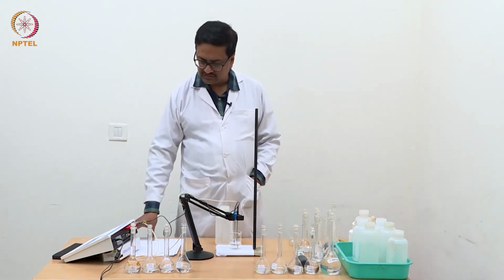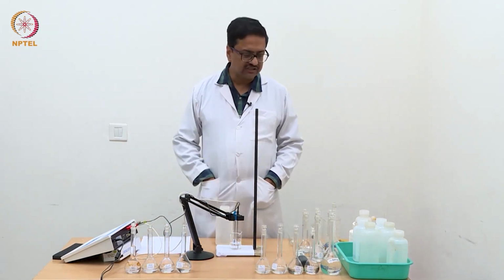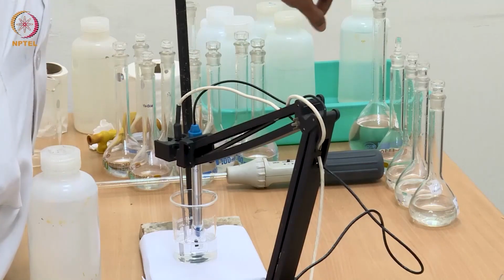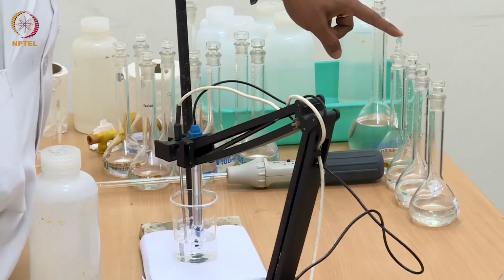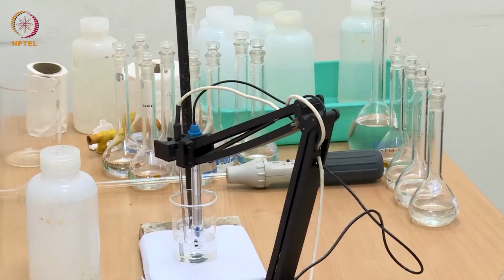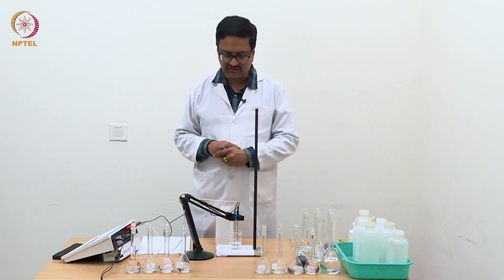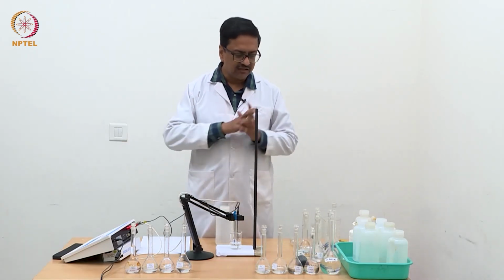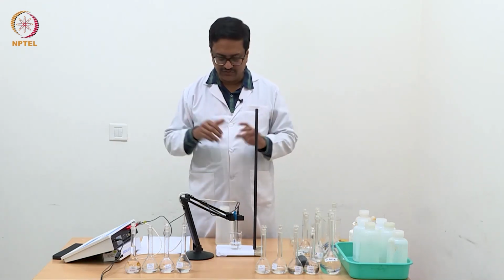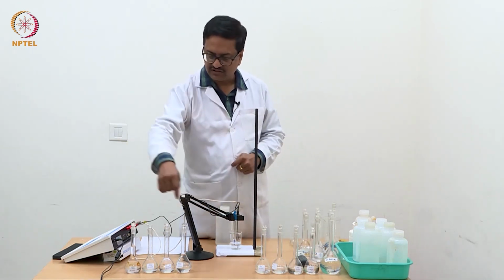And as we discussed in the previous video, now I have prepared dilute solutions of acetic acid. So I have used this one normal acetic acid solution to prepare N/2 acetic acid by half dilution. From this I have prepared the third solution N/4. Like that we have come up to N/256 by half dilution method. So every time I have taken 50 ml of the solution and diluted it to 100 ml to make it half diluted.